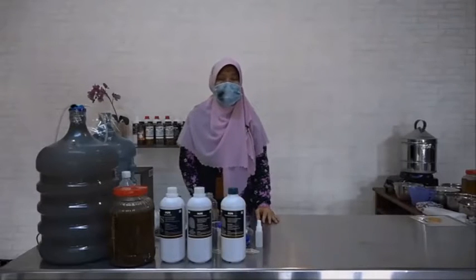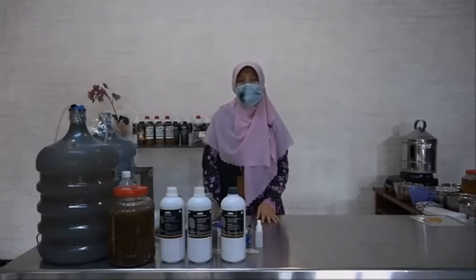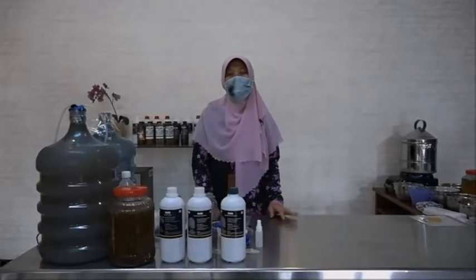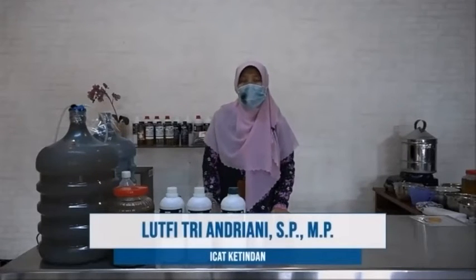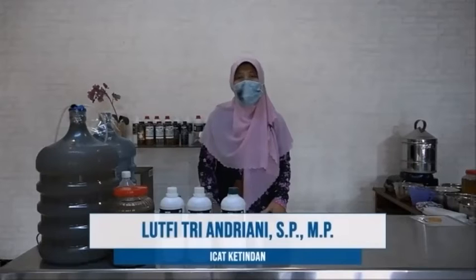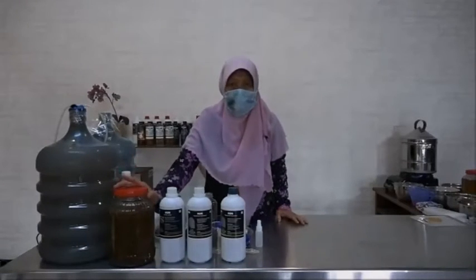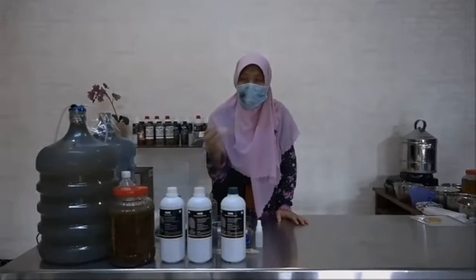Okay, welcome back to this session and meet Lutfi again. And I will have a simulation about propagation of plant growth promoting bacteria, one of the beneficial microorganisms for ecologically based integrated pest management. And we have two methods to propagate plant growth promoting bacteria. The first, we use the bamboo root, and the second, we use the pure isolate.